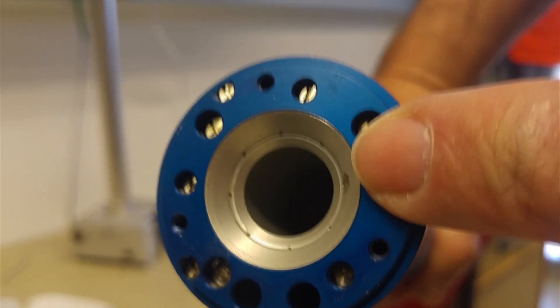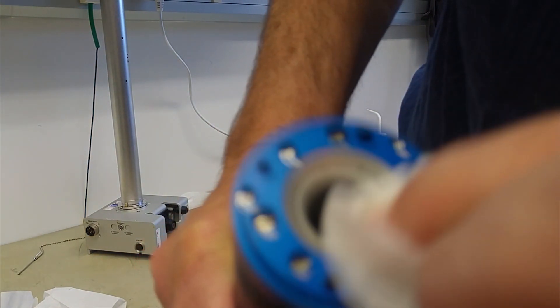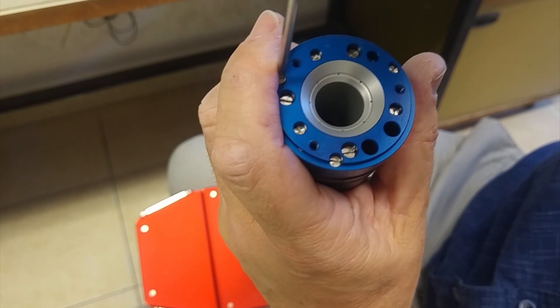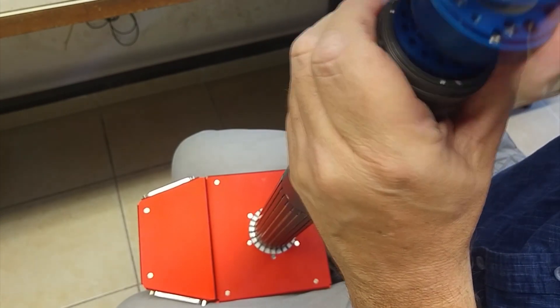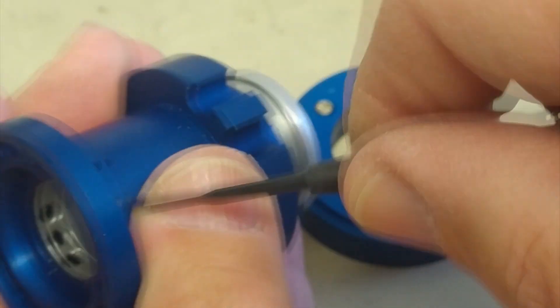Here is the dirt on the turbine that is probably preventing spinning. A quick wipe with an ethanol-soaked tissue fixes that. To be sure that it is thoroughly clean, we remove and dismantle the turbine. Undo the three screws to detach the turbine from the coils. Loosen the remaining screws at the top to take off the top ring. Older models do not have this, but this turbine has an inner flange. Loosen the three grub screws to remove the flange. Clean all the parts by wiping with a tissue, then immersing in ethanol.